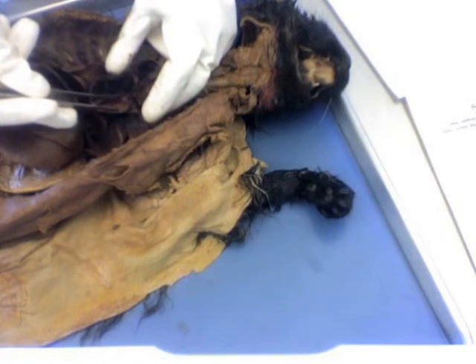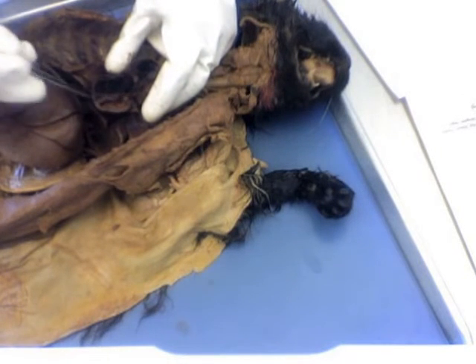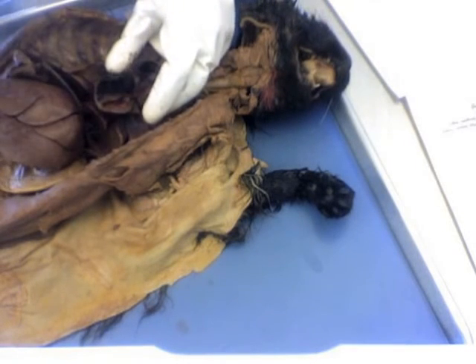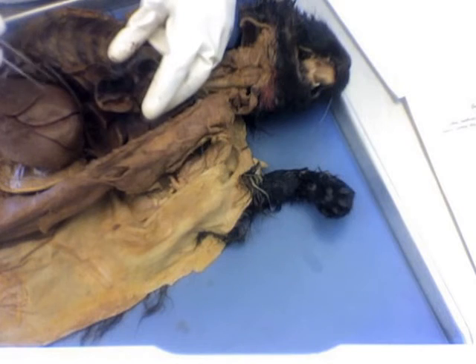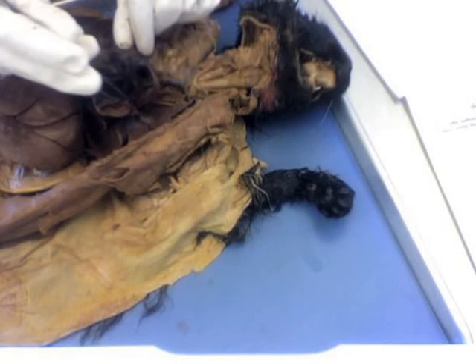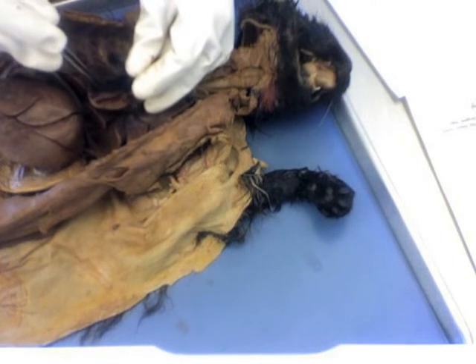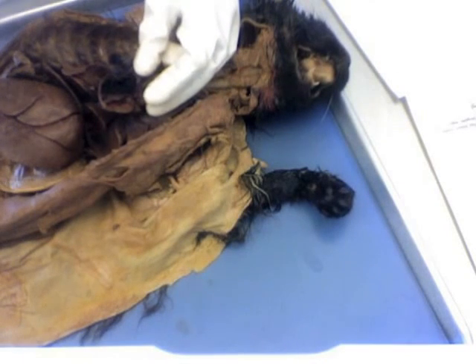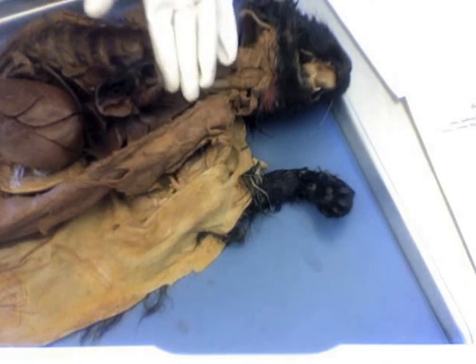That's because the left ventricle is pumping blood to the systemic circulation, so essentially to your entire body, whereas the right ventricle is only really responsible for pumping blood out to the lungs. So the muscular walls there don't have to be as strong and powerful. And I believe that's it. The rest of it we will cover on the heart model.